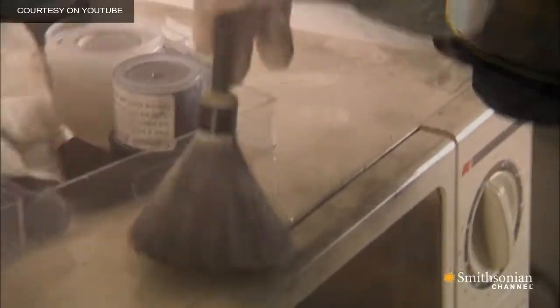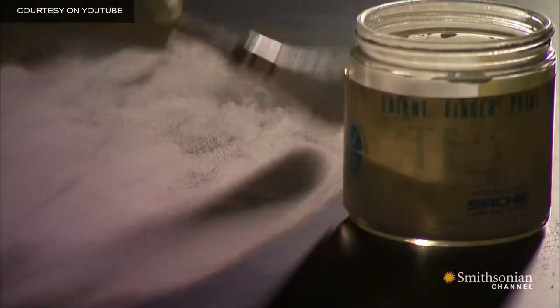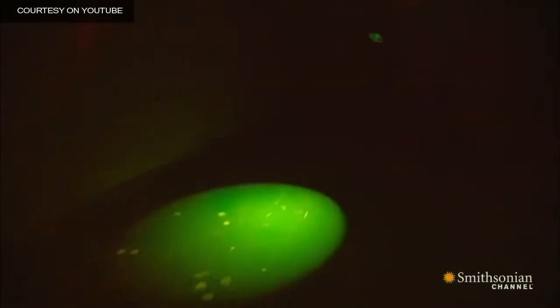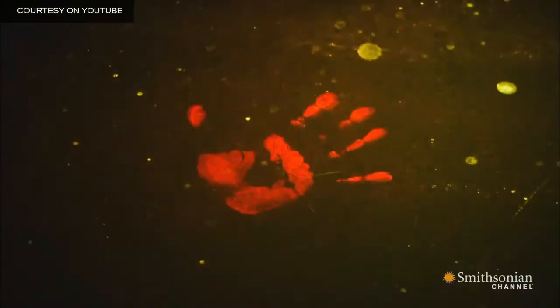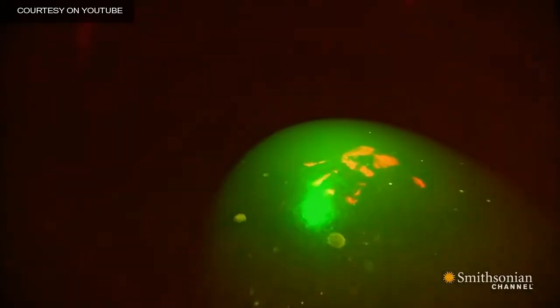Powders. Black powder on light surfaces and white powder on dark surfaces. Each scenario creates a high contrast, making the print visible. But how do you create a high contrast when a surface is multicolored, like some magazine covers, or uneven and textured, like a grain of wood?